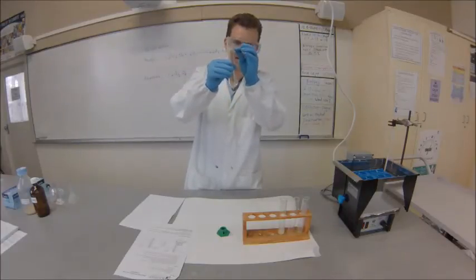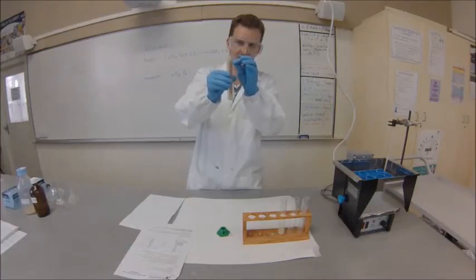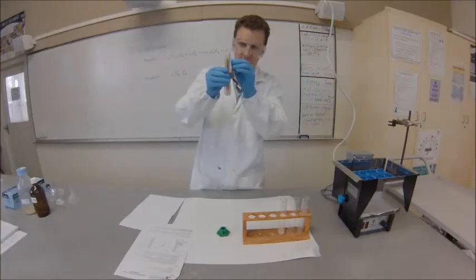You'll see a tiny air gap, but it basically lines up with that first indicator of volume - the one milliliter mark. Then we're going to put this in here.